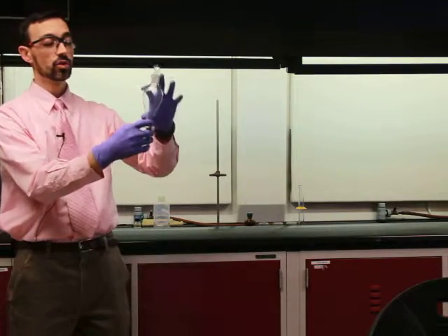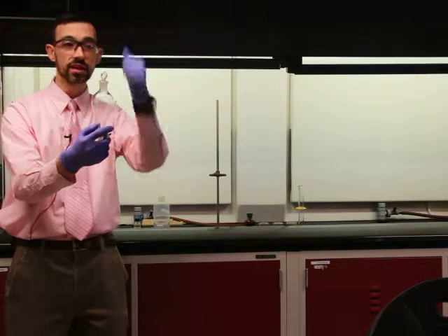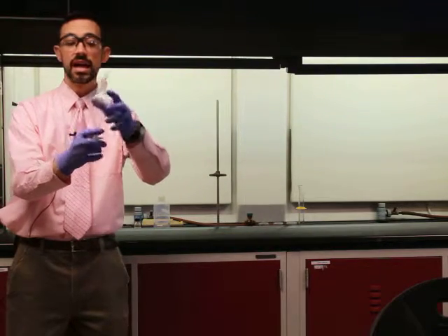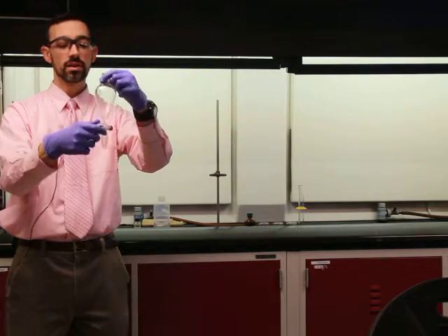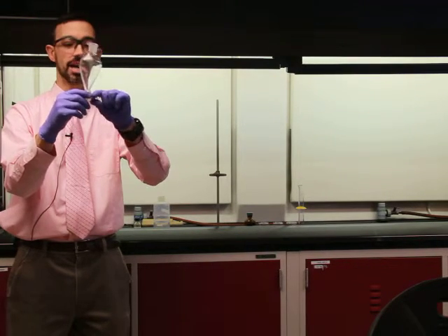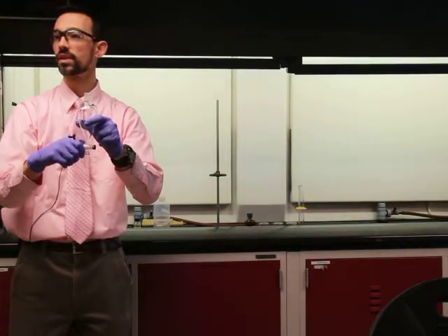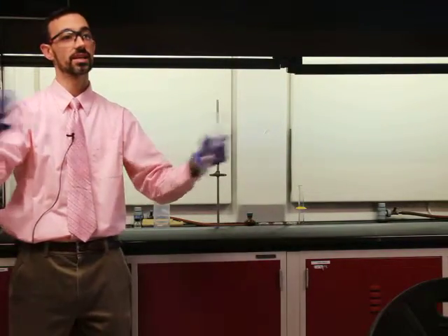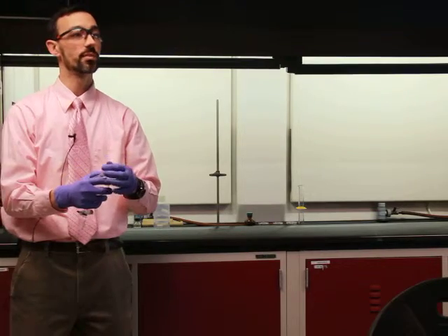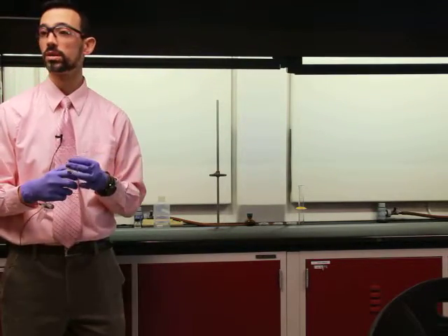So we'll have two liquids in here that'll be separated, like it'll look like salad dressing that you haven't shaken up yet, right? And then you can just drain out through the bottom the one layer, and you can stop it and leave the other layer in here and pour it back out the other direction. And so you then physically have separated the two liquids from each other, each liquid containing now ideally one chemical.